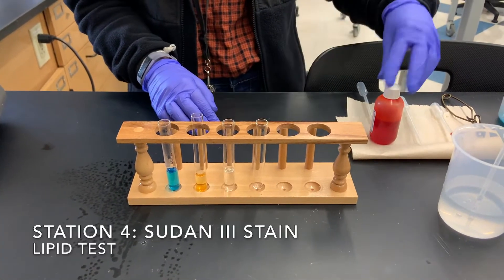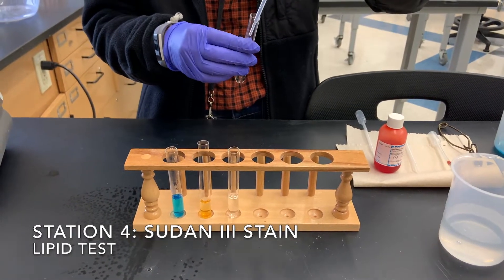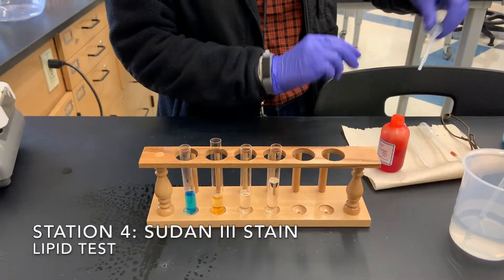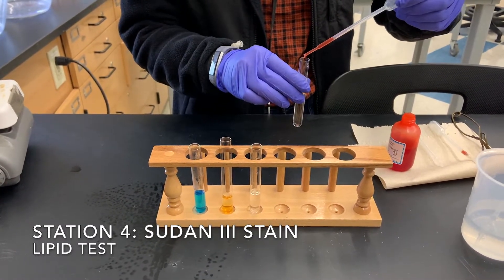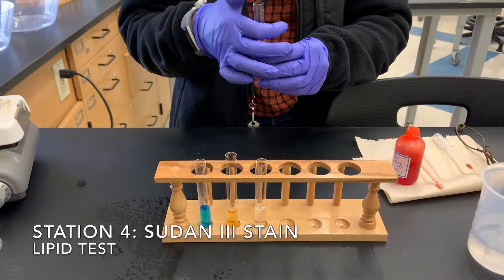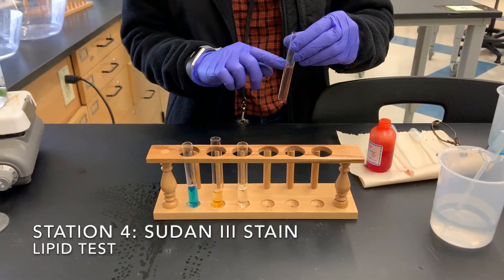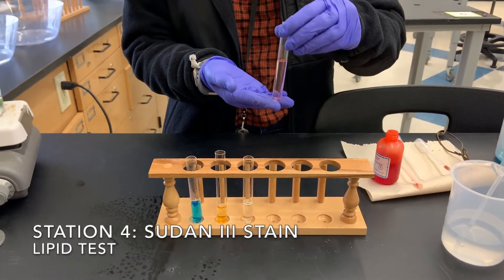Our last test solution is going to use Sudan 3, which is a test for lipids. We are going to fill our test tube about half full with water. Now we are going to put six drops of Sudan 3 in here, then cover with our thumb and shake it. In the presence of lipids, a foamy fat layer would form at the top and turn red. However, there are no lipids in this water and I don't see a foamy layer, so there are no lipids in the water — which is good because it is our control.